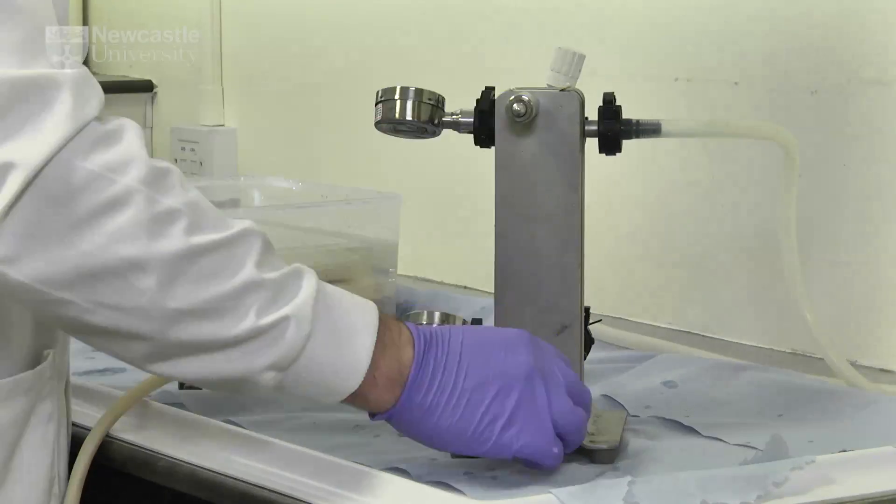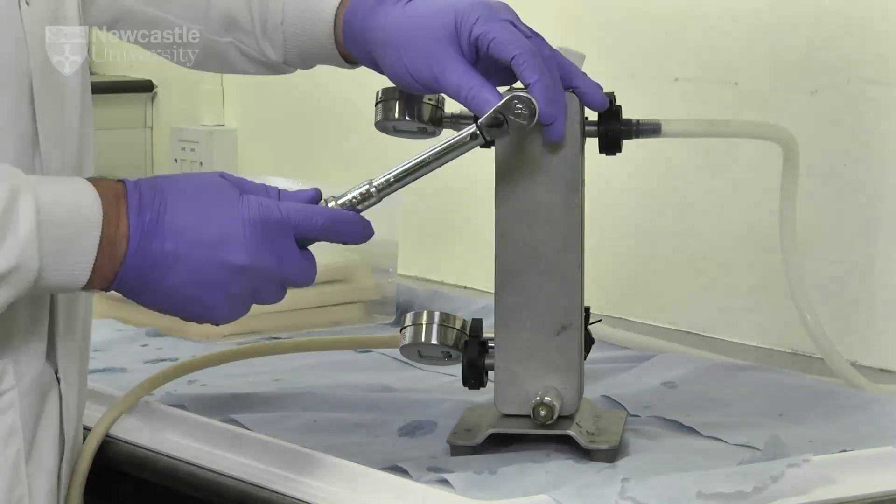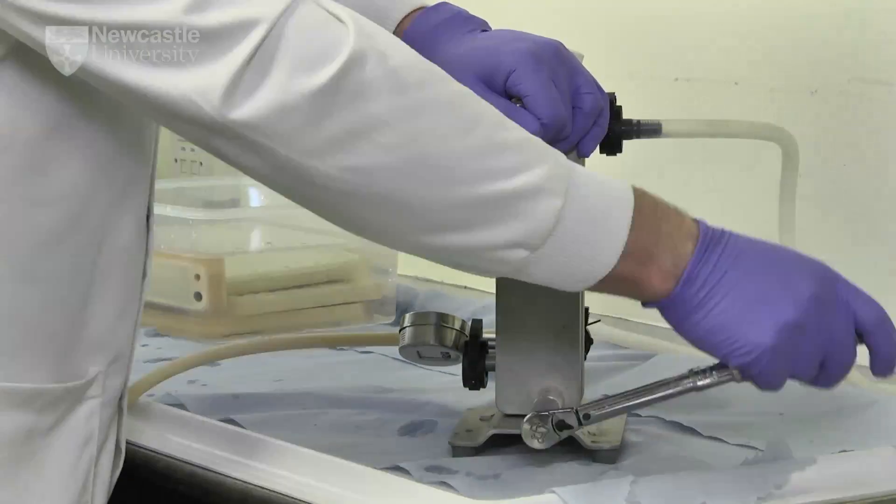The holder is then tightened with a small torque wrench to compress the filtration cassettes between the manifold plate and an end plate.